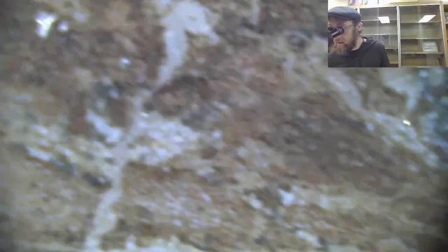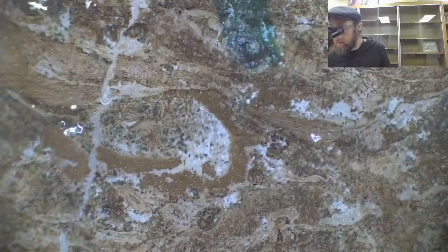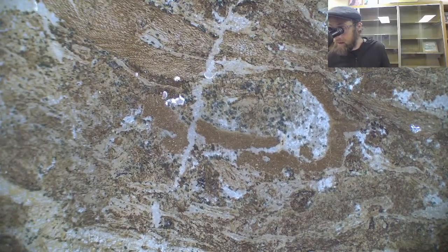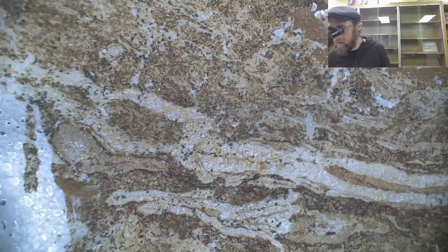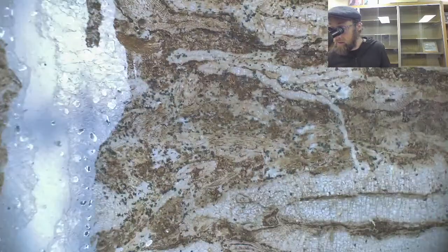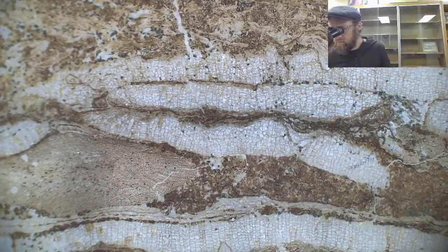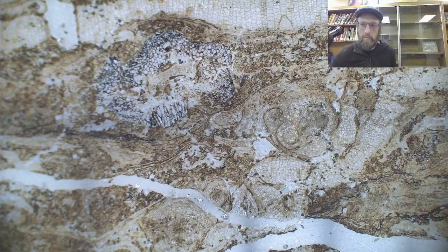Suppose I can just chat idly while I do this, sort of keep myself company. Look up at intervals to see if anybody is taking the bait and watching along. Yeah, I'm trying to find some plant parts in here to orient myself to what's going on in this peel. You guys still there? Do you want to see some of the mineralogy there? Want me to talk a little bit more about the specimens?